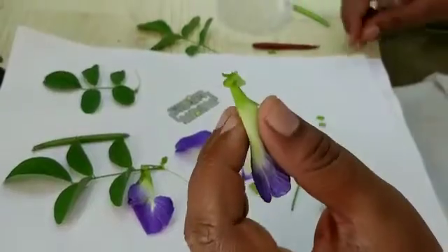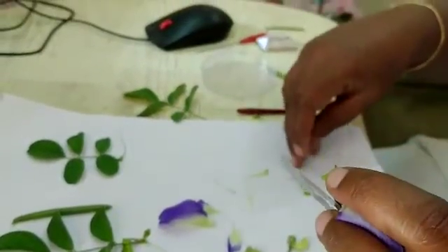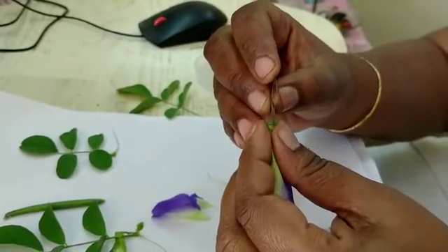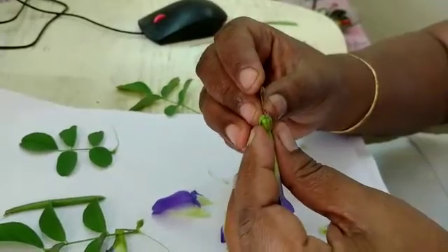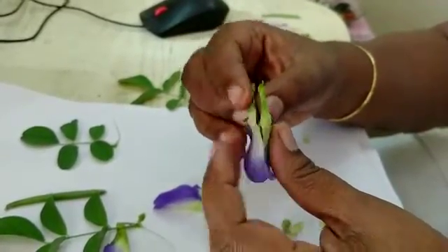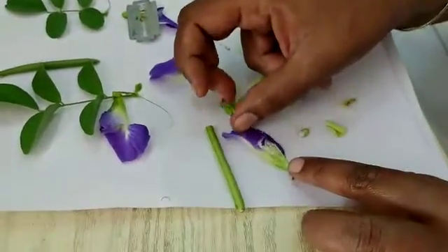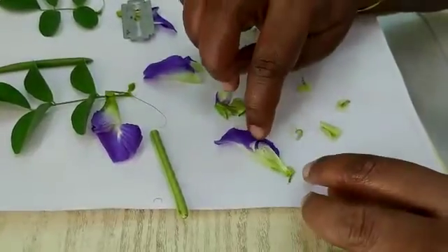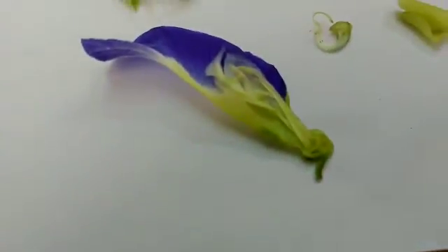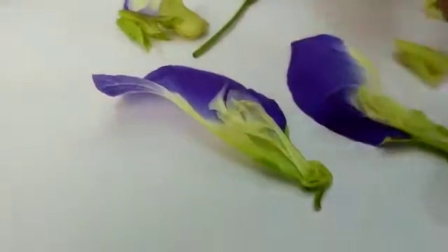Now we will see the LS of the flower. To take the LS, place the flower on a plate and start cutting from the pedicel. Cut one half including the bract, sepal, petal, androecium, and gynoecium. Half of the standard petal should be present — that is important. Half of the wing petal and half of the keel petal, including your stamens and gynoecium — everything should be there.